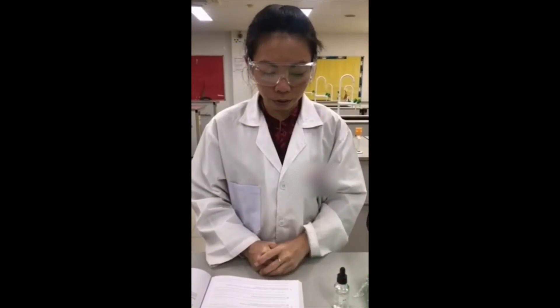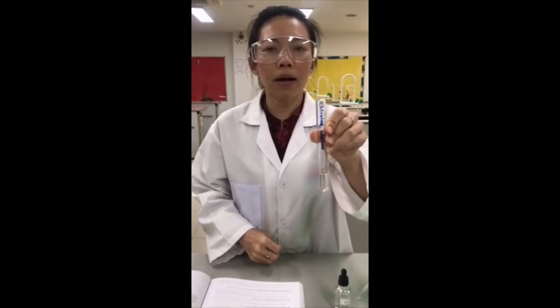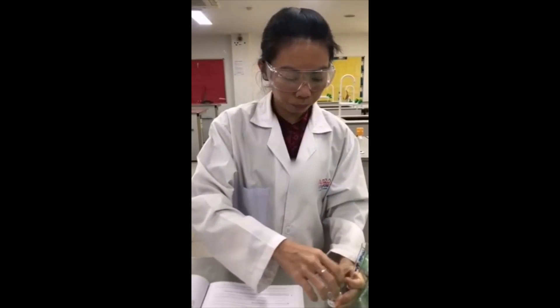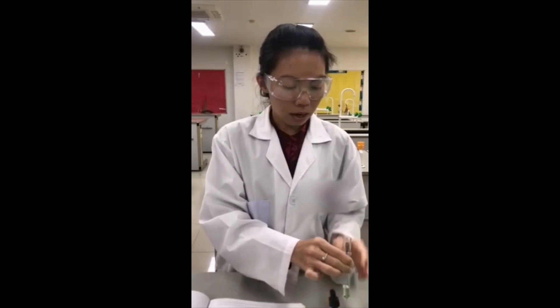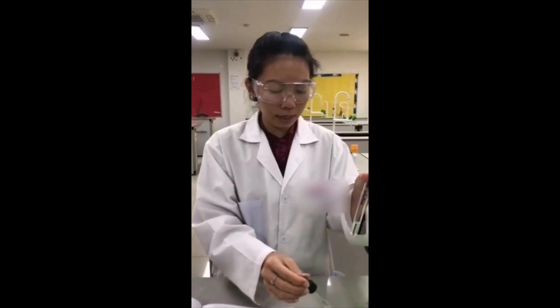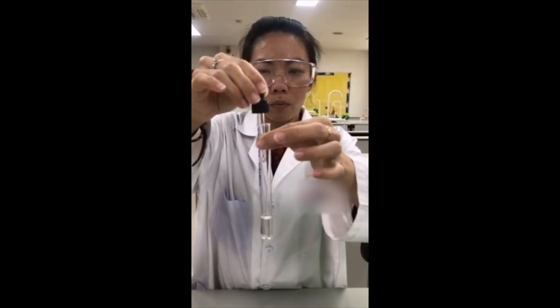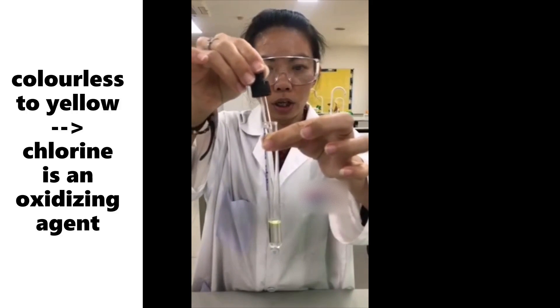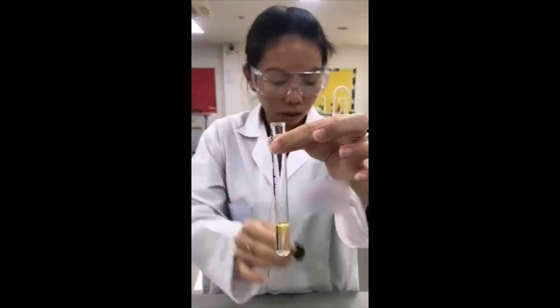In test three, we're going to react chlorine solution with potassium iodide solution and see whether chlorine is an oxidizing agent. As you can clearly see, the color of potassium iodide is clear and colorless. Chlorine is slightly yellow-green. When I add a few drops of potassium iodide, the color of the solution turns yellowish, and the more I add, the darker the yellow tinge.